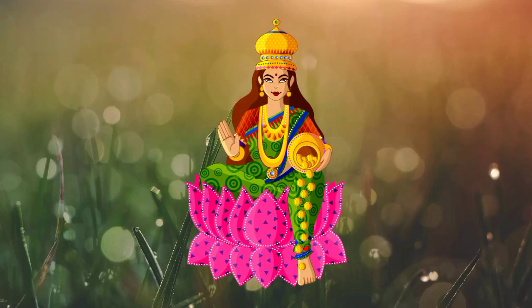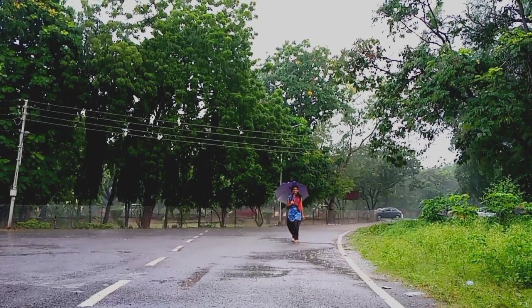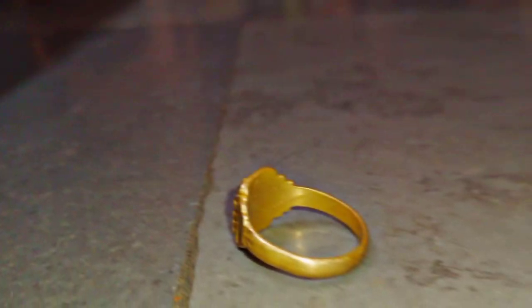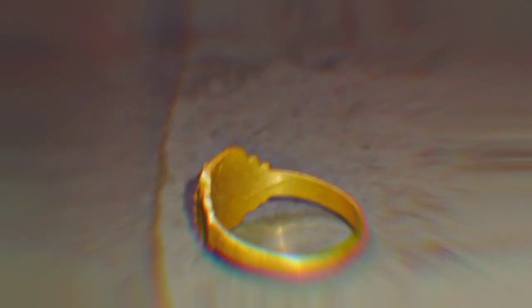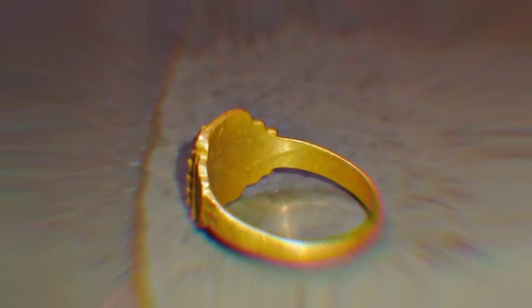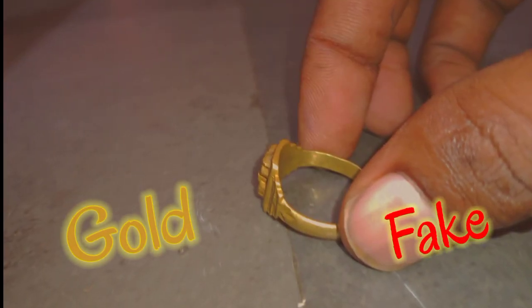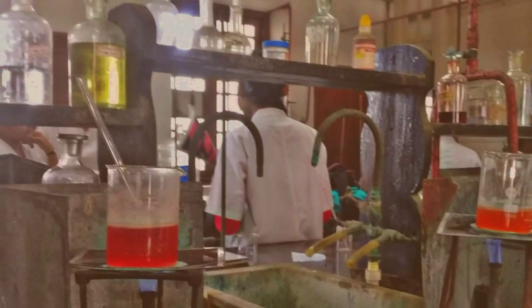Hello friends. You are walking on a road and you found an ornament which looks like gold. You want to find out whether it is gold. We cannot detect whether it is gold or fake rolled gold just by looking at it. As a chemistry student, we can know some techniques which we use to detect gold.